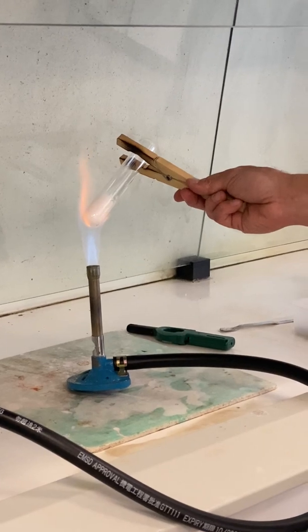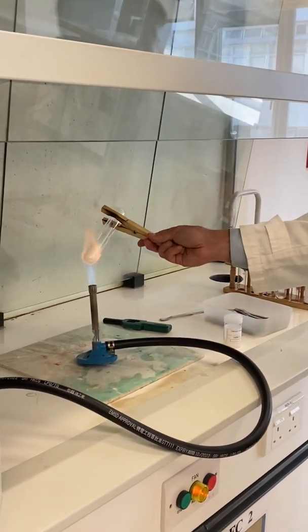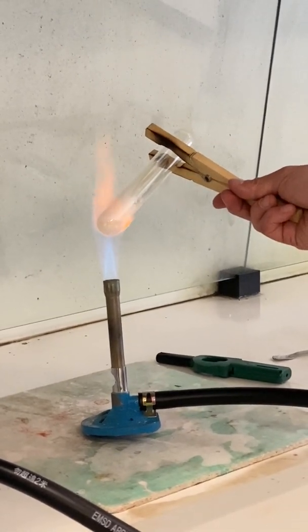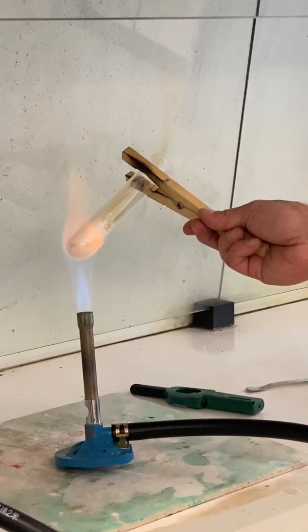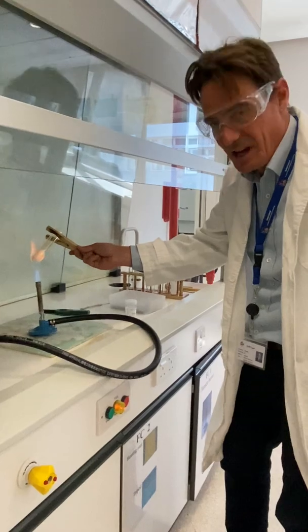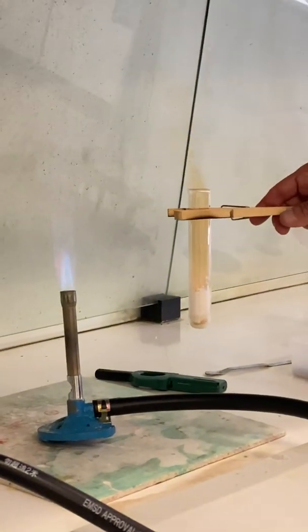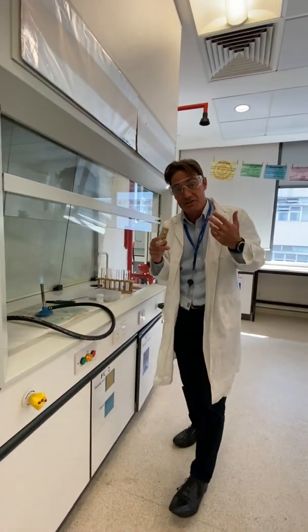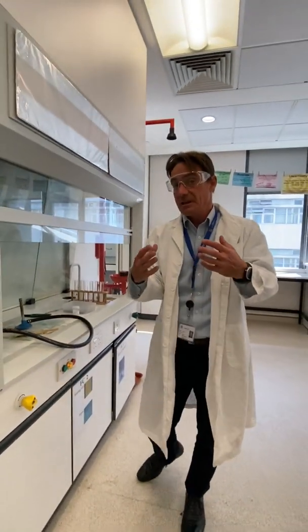Will we get brown fumes? It is harder, but — we are getting brown fumes, you can see. So unlike the carbonates, all the nitrates will decompose, they just get more difficult to do so. Clearly brown smoke coming off. When we did it with calcium carbonate, we couldn't get the limewater to turn at all. The difference here is that the group 2 nitrates will decompose — it just takes more effort.